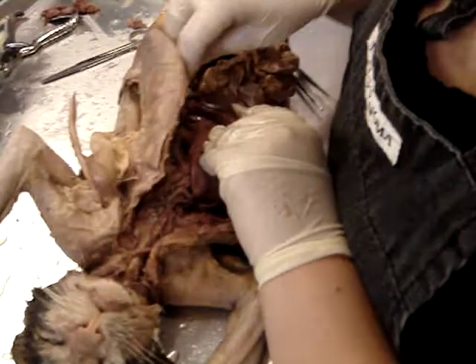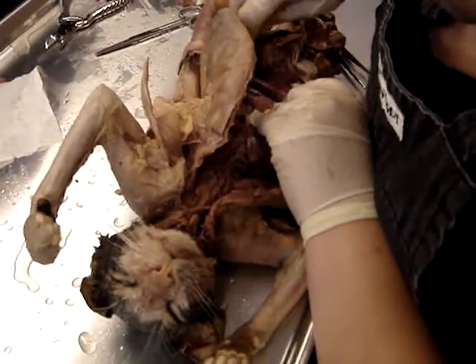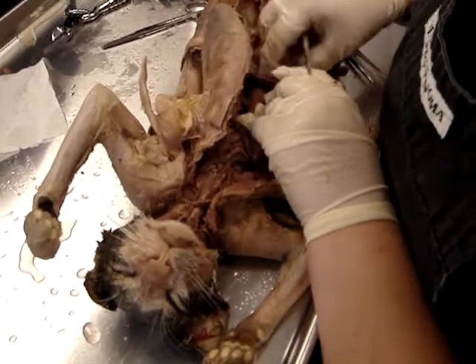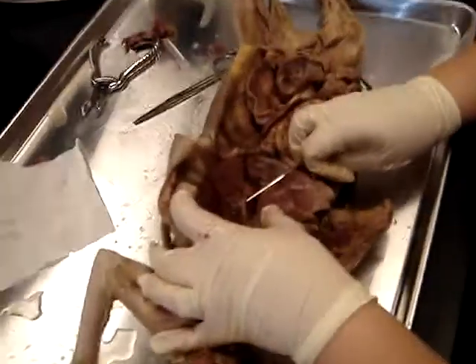And that, there's no way. That's got to be the esophagus. That's just ridiculous. Because it's huge. Yeah. And yet, hold on, let me grab the stomach and pull on the stomach. Yeah, no, that's it. Okay, so this is just a very large thoracic aorta.